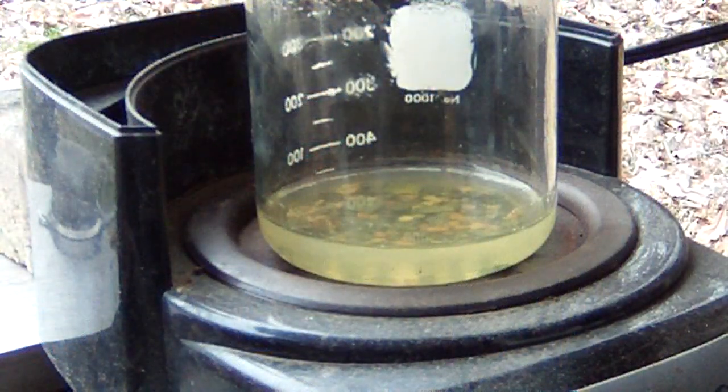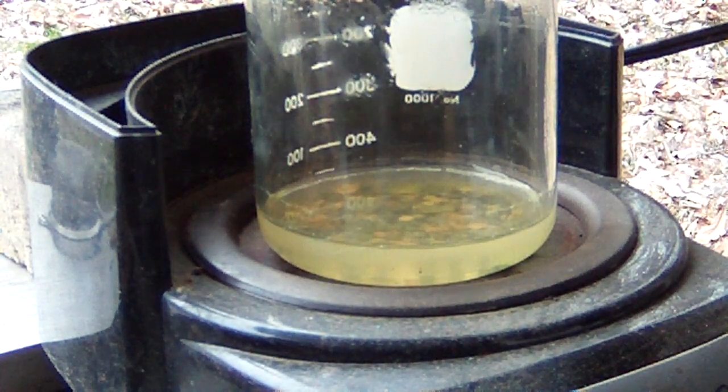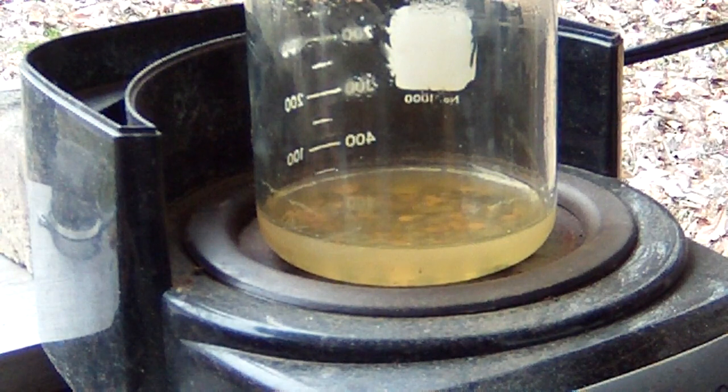Okay guys, so what I did was I rinsed those remaining contacts that were in the bottom that haven't dissolved, and I got all that gray powder off of them, which seems to block some of the reaction or whatever. It looks almost the same as the stuff from Dr. Z's, the powder that just won't dissolve. So in any case, I put these back in, put a little bit more distilled water, and then added a little bit of nitric acid to it, and we are getting a little bit of a reaction again, so I'm just going to go ahead and let that work again. Maybe we'll get rid of some more of that powder, see if we dissolve any more of these contacts. I didn't separate out what I know to be tungsten. I'm just going to leave it, but we'll go ahead and let this work for a while and see if we can pull any more silver off of these. So we will get back at you after a while.